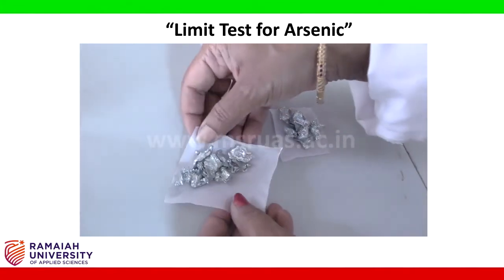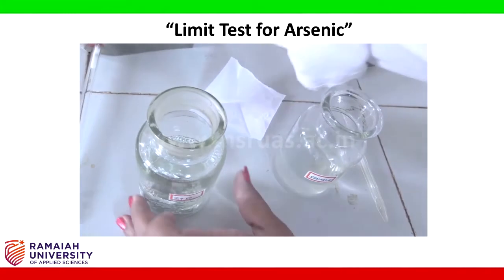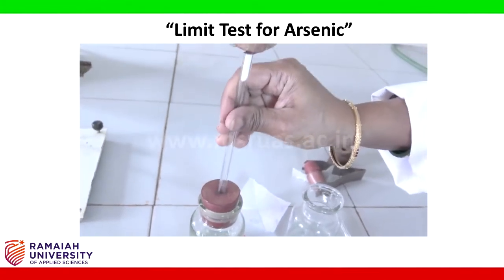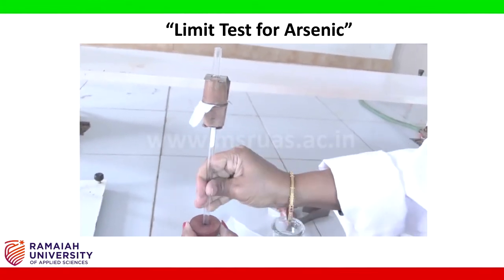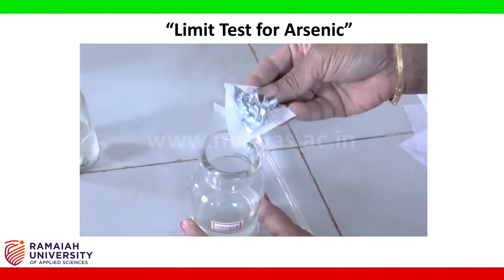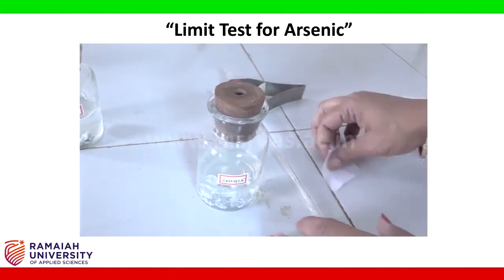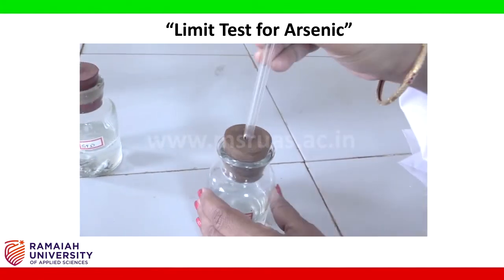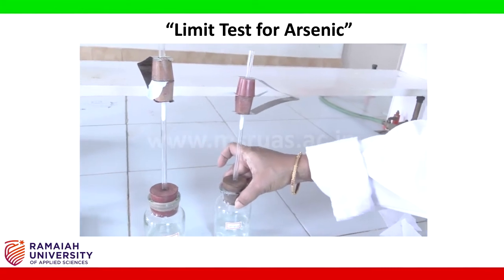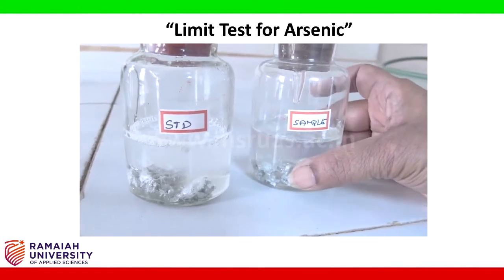Now we will add 10 grams of zinc granules into the standard apparatus and stopper it immediately. Similarly, we will add 10 grams of zinc granules into the sample apparatus, stopper it immediately with the capillary tube. After arranging the apparatus, allow the reaction to take place for 45 minutes.